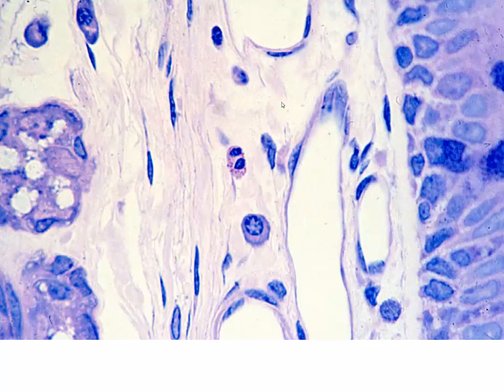Once again, more cells in our connective tissue. Nice examples of fibroblastic cells, elongated, tapered nucleus. We've got some blood vessels in here. And then we have these cells that stain with these dark red granules. This is an eosinophil. It looks binucleated, but eosinophils have bilobed nuclei. One nucleus, but in this plane of section and its cut, it looks to be two.